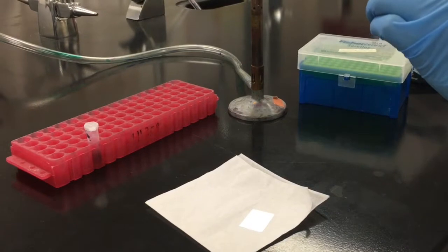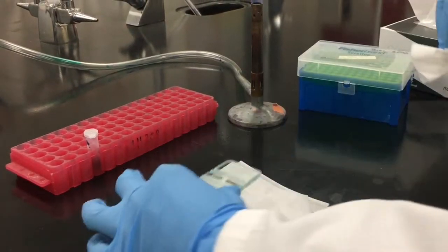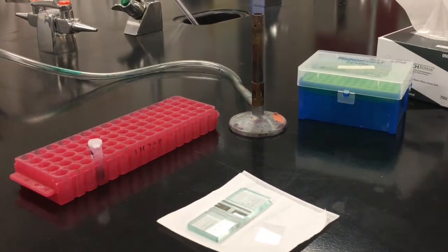We will be loading our hemocytometer with our Bunsen burner ignited so our tip box remains sterile. Be sure when you're preparing your dyed suspension you do so aseptically as well.